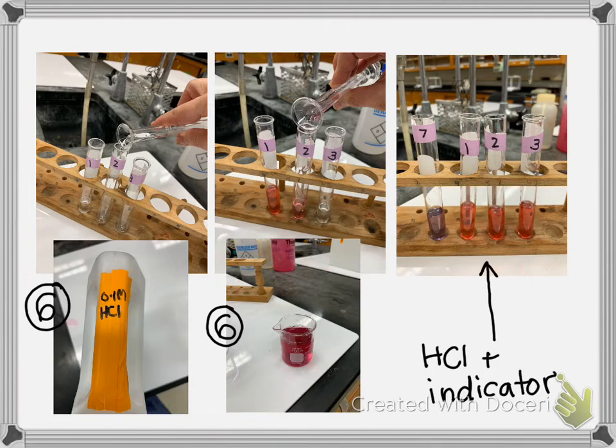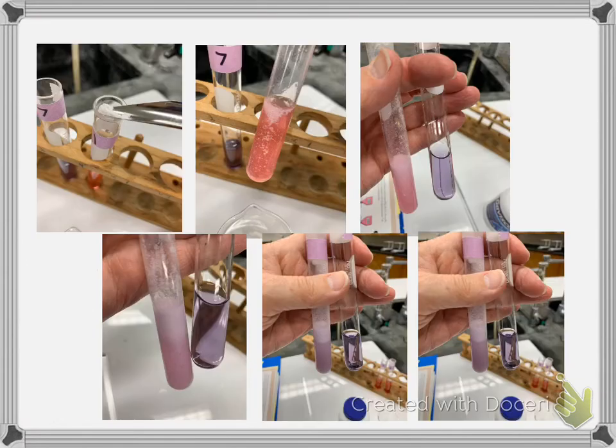And then over here I have a test tube with a pH equal to 7, because it's going to tell us to the test tube we want to add our antacid until we neutralize the acid in our test tube. So you can see the progression. If I were doing it, this is when I started. I'll just say I started at A, then I added a little, and they say just shake, but I gently mixed with a stirring rod.